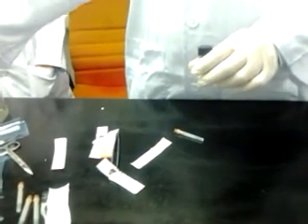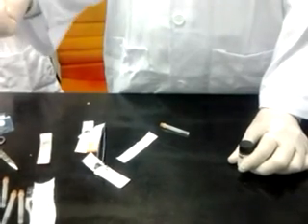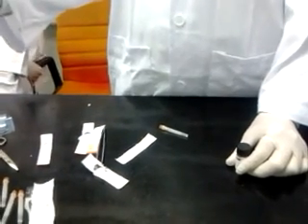With IM, you will be sedated, but not sleeping, because by the time the drug reaches the liver, the brain, everything, they break down the drugs. So you have to give higher: less volume but higher concentration, maybe 0.1 ml per 100 gram. I take 0.03 and give to the animals, which means they are getting the dose for more than 100 grams, so that they have enough dose.